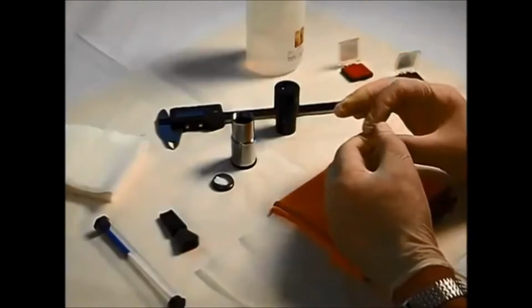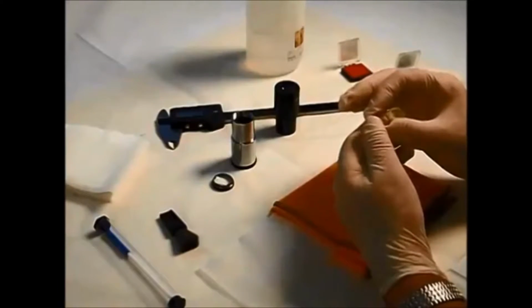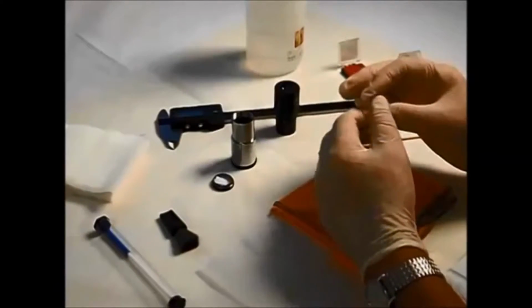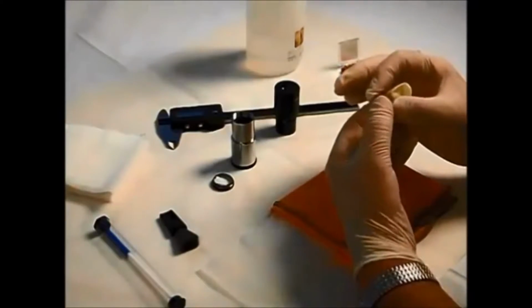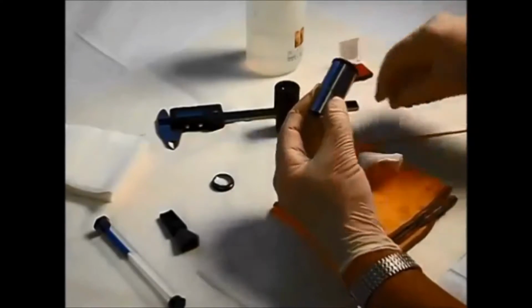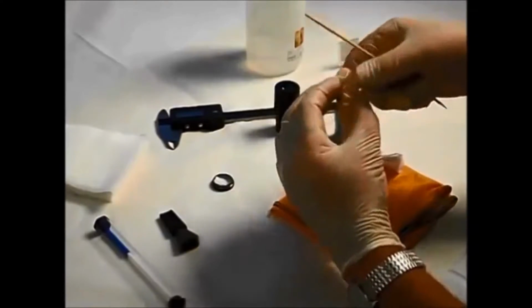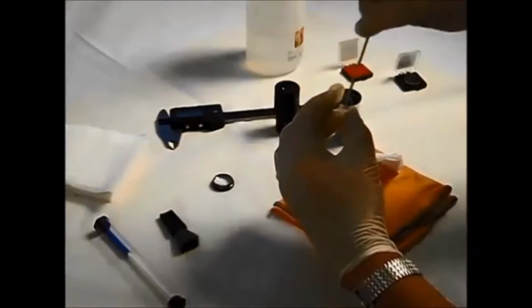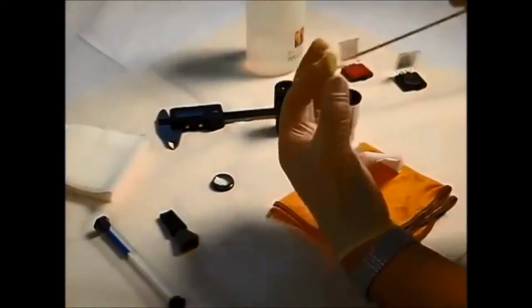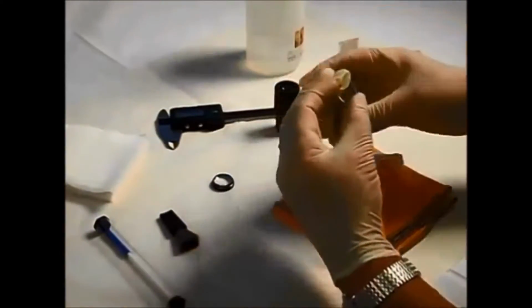Now, a reticule has two sides. The orientation of the reticule can be difficult to see while it's out of the eyepiece. Now, if we get this round the wrong way, when you look through the eyepiece, any text or numbers is going to be the wrong way round. Now, the way that it's intended for use is in the following manner. You look through the eyepiece from this side down through the microscope, and similarly through the reticule to the side which has the chrome image on. So you're looking through the glass to see the chrome image. So we need to assemble it with the chrome image on the downside.